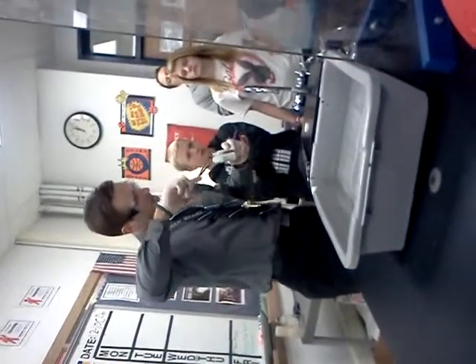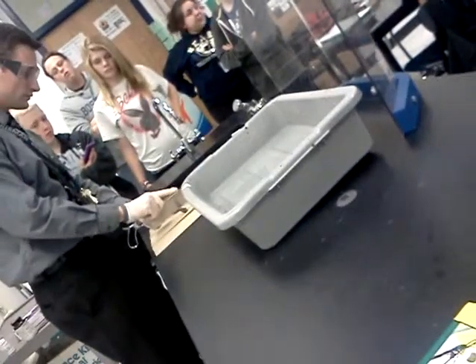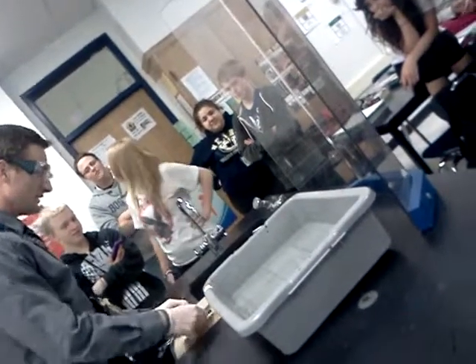All right. Thank you. Lithium is first, and it's a shiny metal, but it doesn't look all that shiny. It doesn't look very shiny because it will react with oxygen. So to see the shininess, we have to cut it. And what we can see is we can expose the lithium metal, and it is shiny. After a while, though, it'll turn into this dark gray color because it's reacting with the oxygen in the air to form a little tarnish.